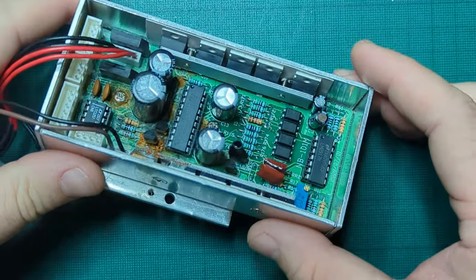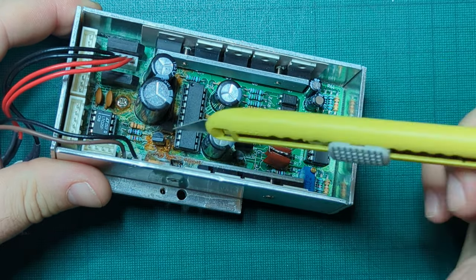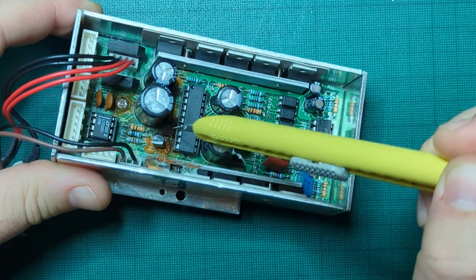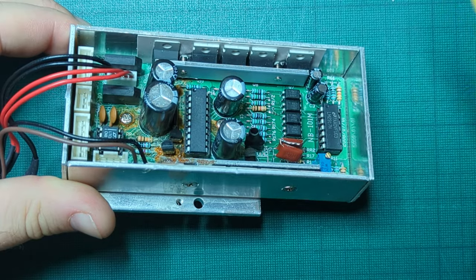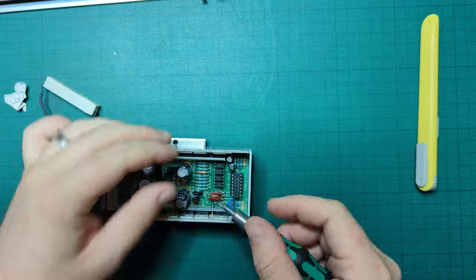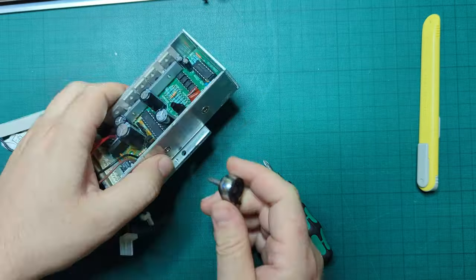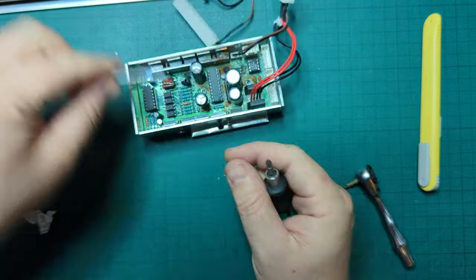No, I don't think the weird audio will give away the fact those were clips of me putting it back together that I then reversed. Anyway, I've found no mechanical linkage broken inside like the listing suggested, but I did find this. It's a control board of some kind with rust on, and I'm no electronics expert, but I know that's not a good thing. Clearly, all I can do now is take it apart and see what's damaged.